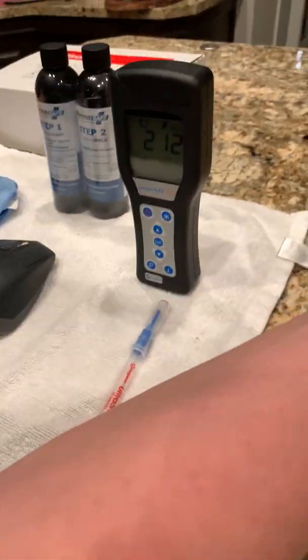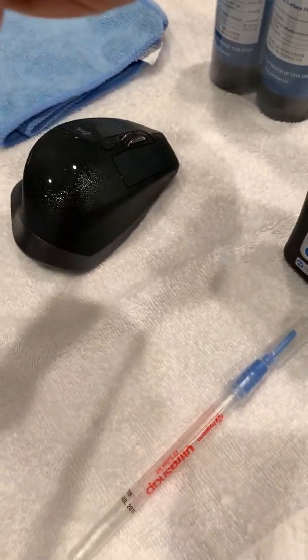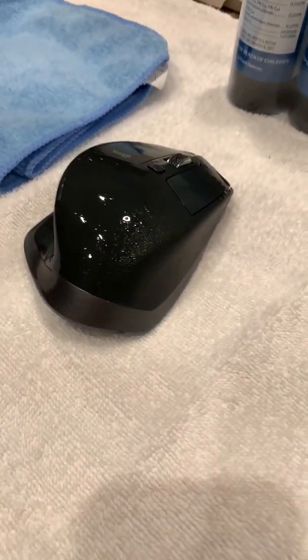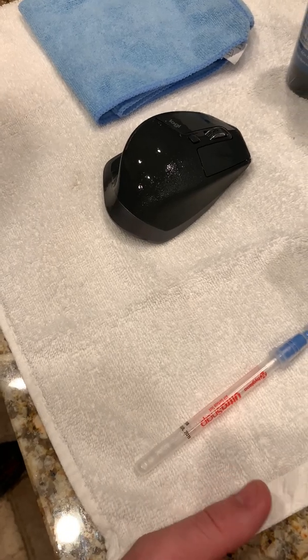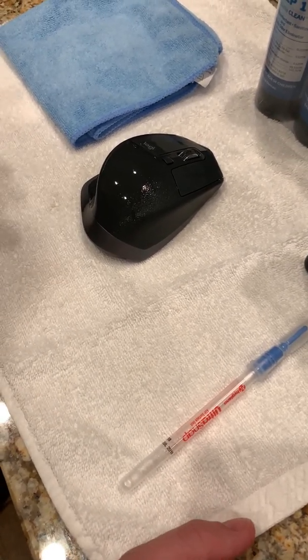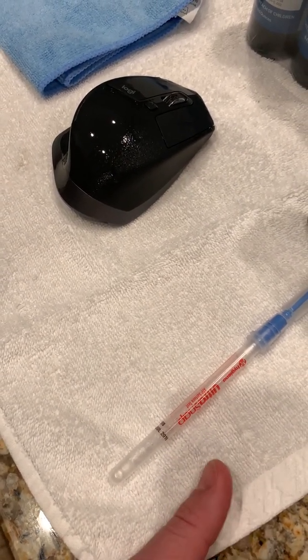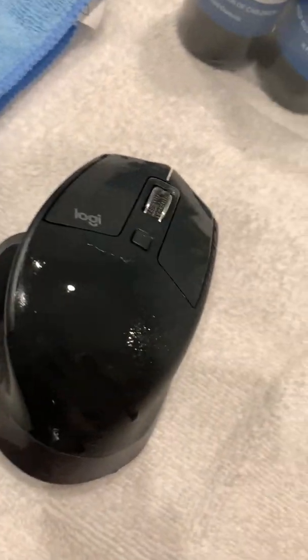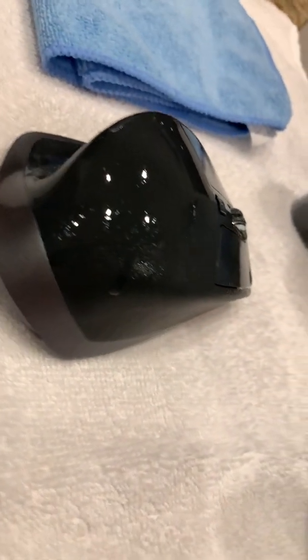I'm going to go ahead and take the bottle that I pre-filled with Permasafe Step 1. I'm going to spray the computer mouse and let it sit. Now while that is being treated, anything that's left on this surface after a couple of minutes is just water — the bond and the disinfection will have already happened. So if you are treating a surface that does have a collection of liquid on it, after a couple of minutes you can just wipe it off with a microfiber or an otherwise clean towel.